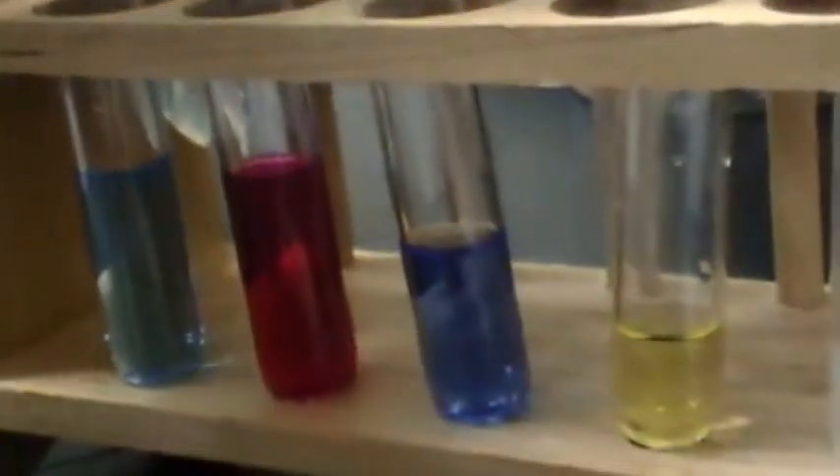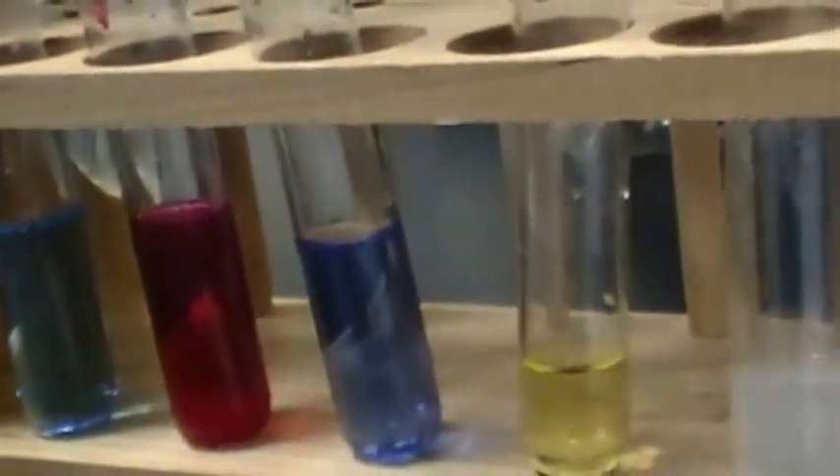Let's go with lavender. Now we're going to do our third milliliter. I like these colors. And it just stayed the same — it just got lighter, just changed concentration.